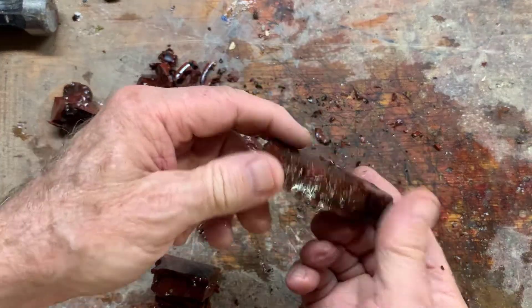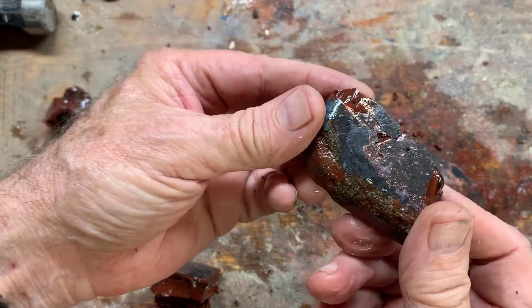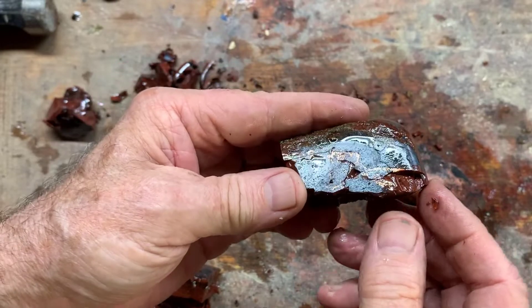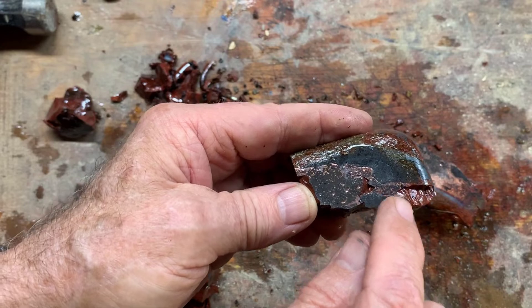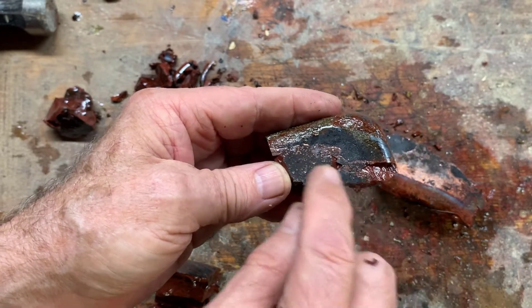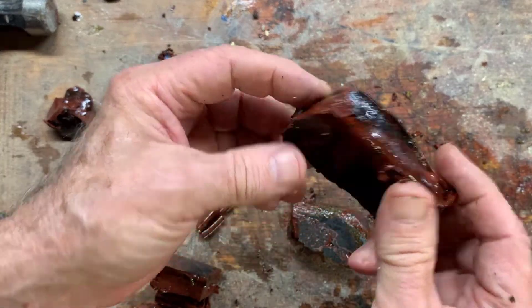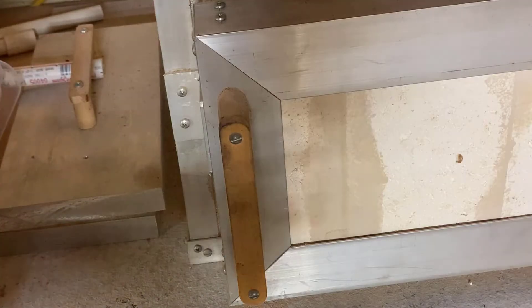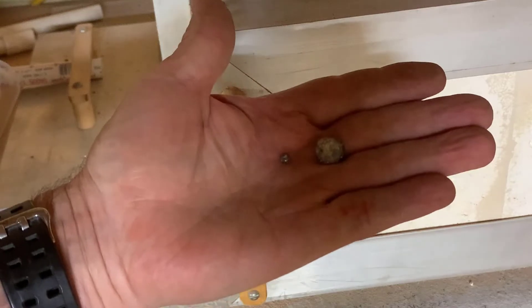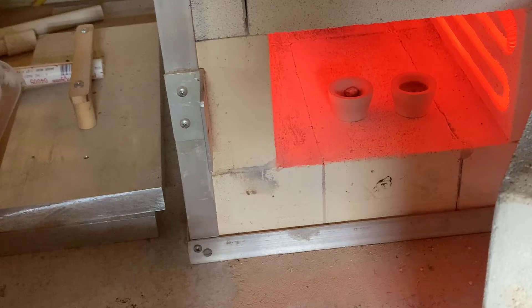Here's the slag from sample 108 — it's really totally different. You can see the copper actually got reduced by the iron in the pan where it touched the iron. That's kind of beautiful. And it's just totally full of copper — really heavy slag. I've got the lead from sample 102, and we'll put that in the left-hand cupel.